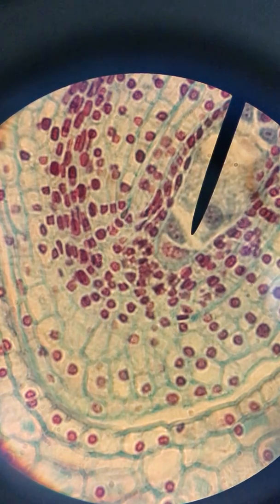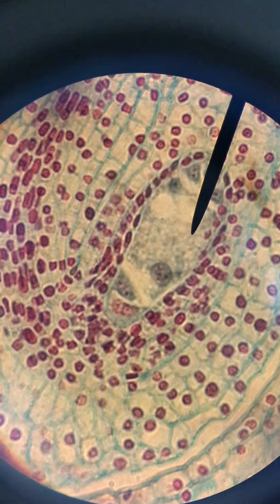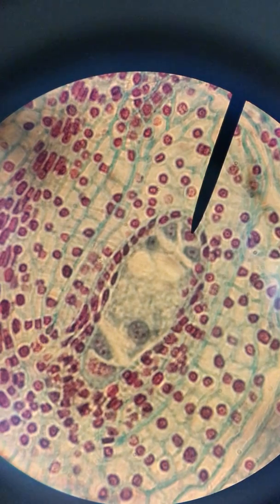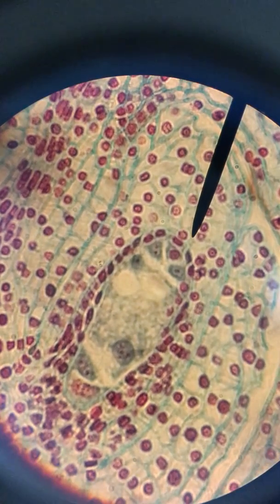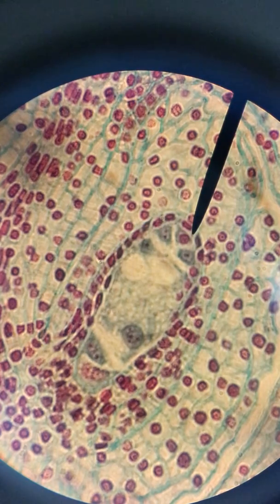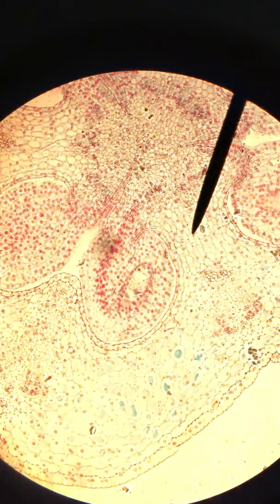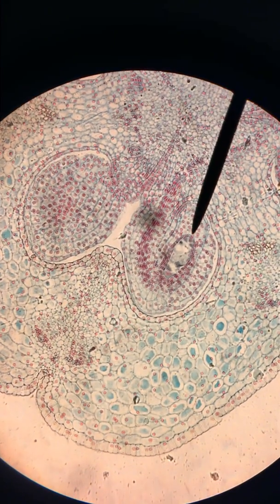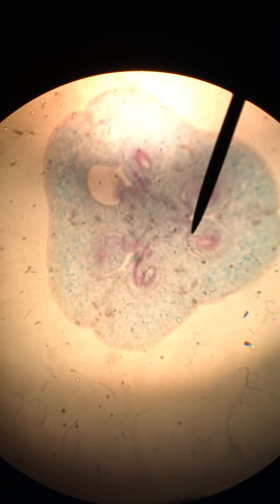So for this slide, which again is slide 8, our mature female gametophyte or embryo sac — we've seen at least seven if not eight of the nuclei that would be present, as well as the micropyle, which would be the pore where the sperm would enter to undergo double fertilization. Those are the things we need to see in slide 8. I will zoom out once more so you can see the whole thing at about 100 times magnification, showing our ovule and the entire ovary.